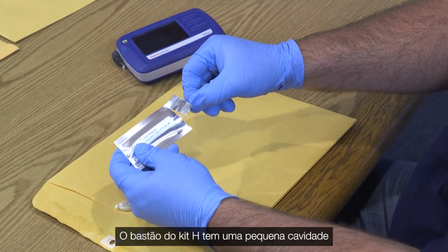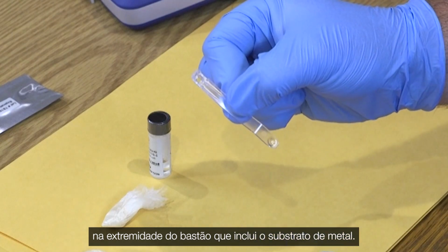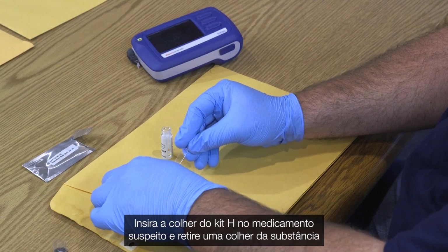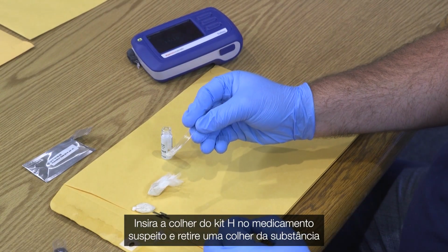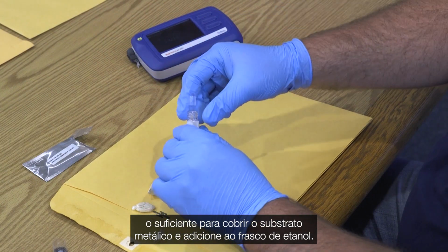The H-kit stick has a small cup indenture in the end of the stick which includes the metal substrate. Insert the H-kit scoop into the suspected drug and remove 1 scoop of the substance, enough to cover the metal substrate, and add to the vial of ethanol.